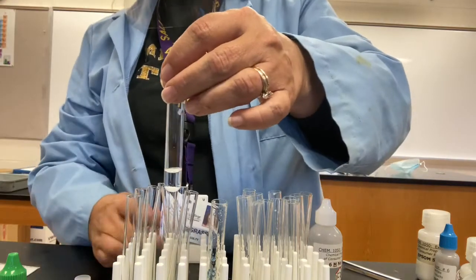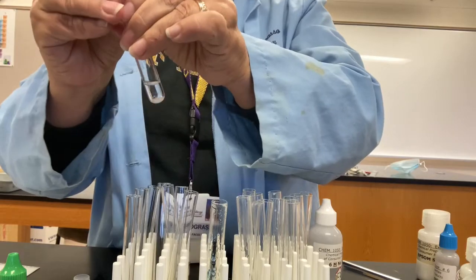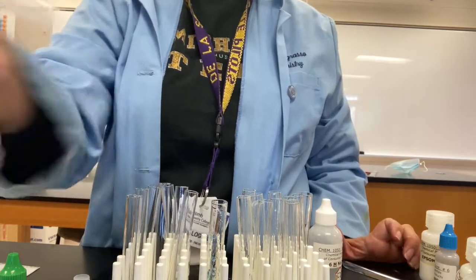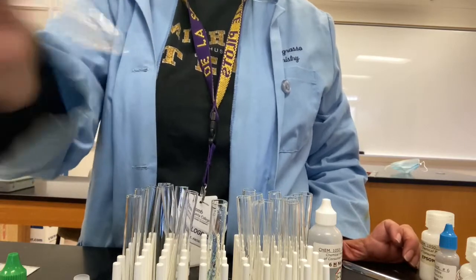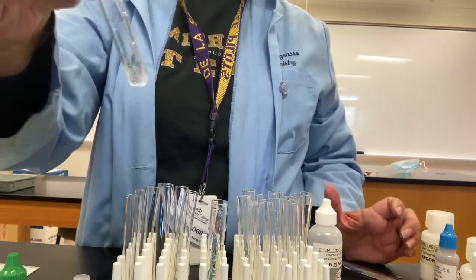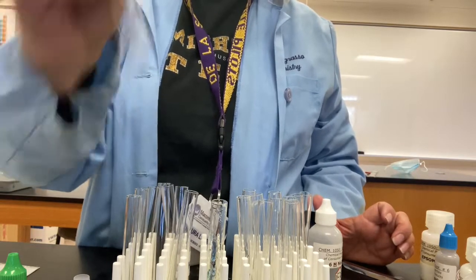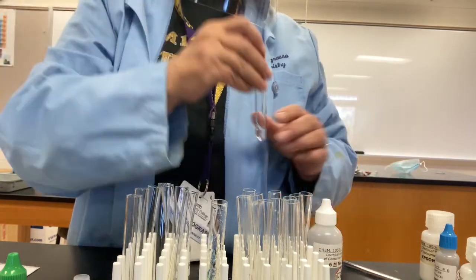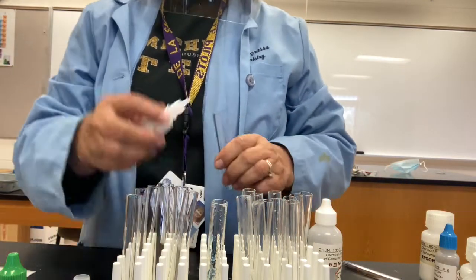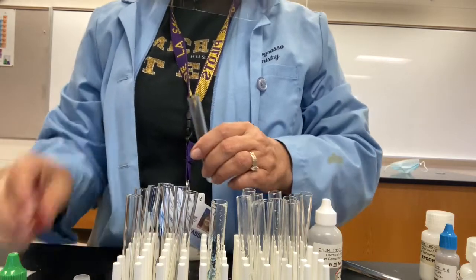Now I want to dissolve this up a little better than the last one so that you can see for sure that we're making a solid only when we add the barium chloride. It's a little bit stubborn. Pretty well. There's little crystals down at the bottom. I'm going to add a little bit more water to it to get it to dissolve up a little bit better for us.